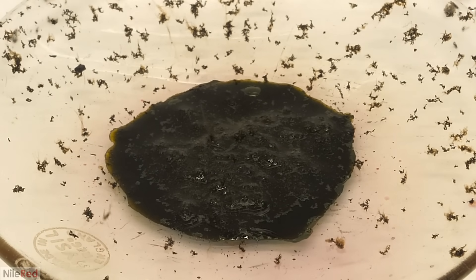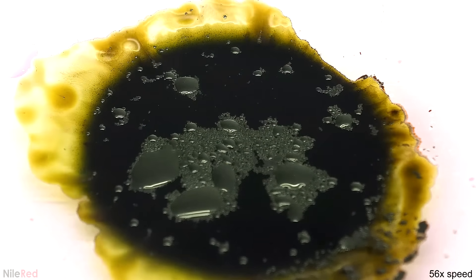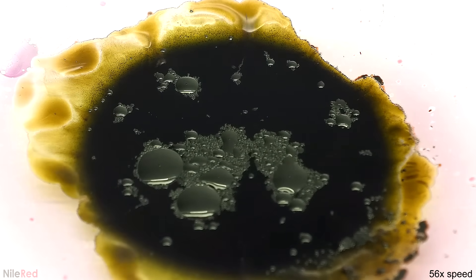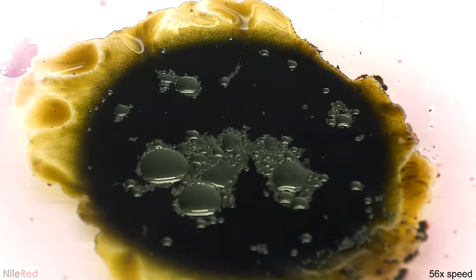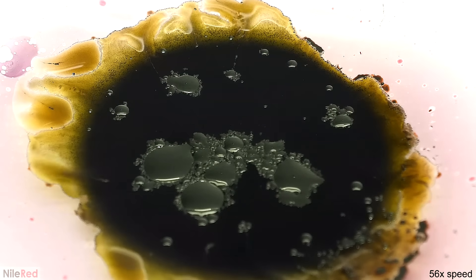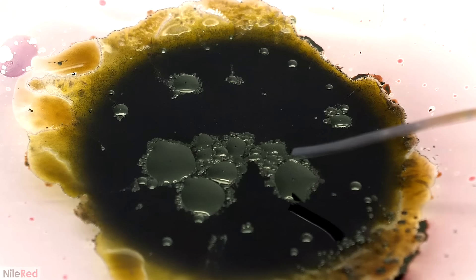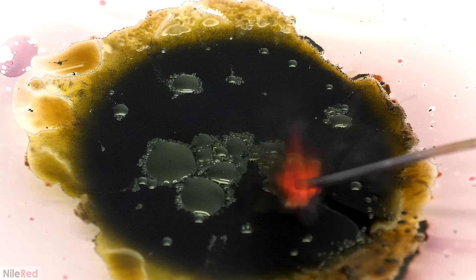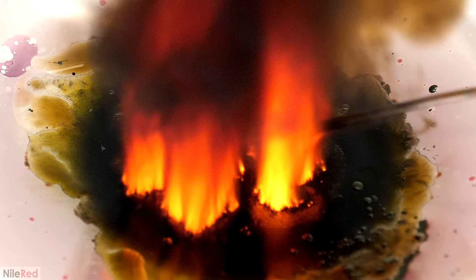All of the green oil at the top was the manganese heptoxide and you can see that almost immediately it all reacted. However, when the amount of permanganate used is low like I did for this first run, and when the temperature is below 55°C, you don't have to worry too much about it spontaneously decomposing. It's only really when you add quite a bit of it and you get all of that oil floating on the top.